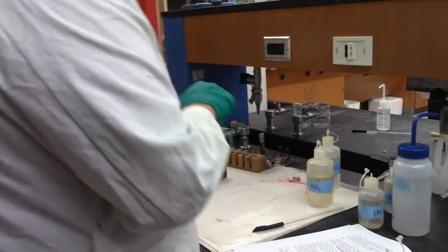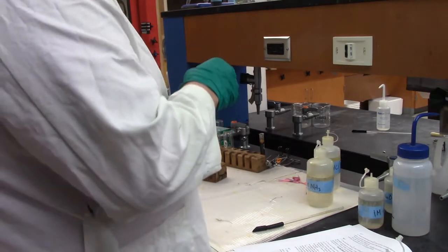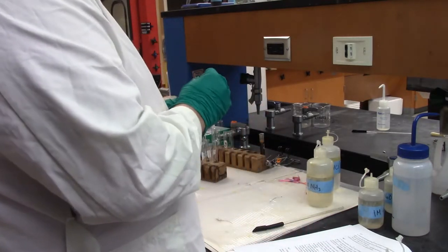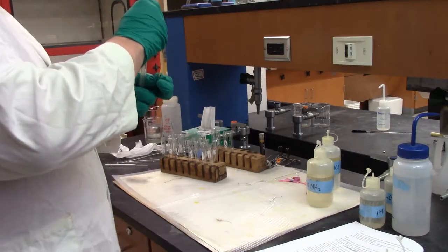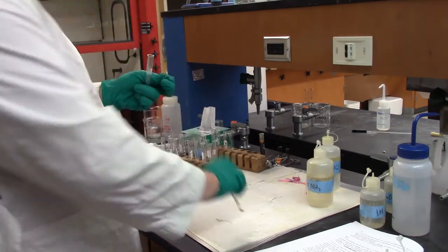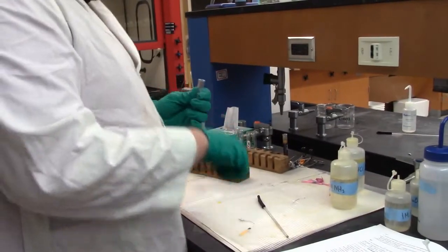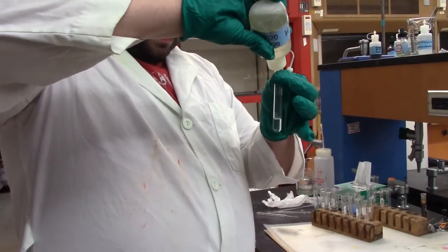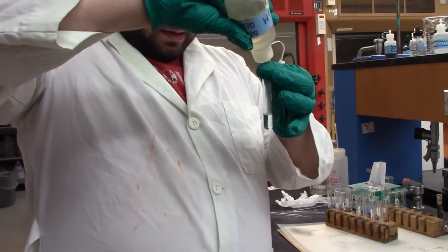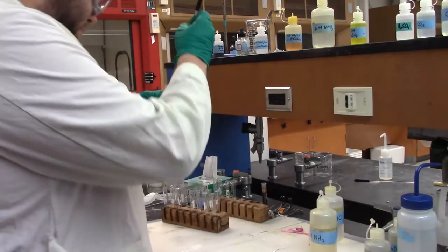So, we're going to acidify it, which means to start with, we need to test where we're starting from. And all of the pH paper I had out a minute ago is destroyed because I put it in something acidic, so it's now all bright pink and unusable. So I'm getting a fresh one. The samples are in fact basic. So now I'm going to add some acetic acid until we're not basic anymore. As you can see, a little bit of smoke coming off of that, but not much of a change otherwise.